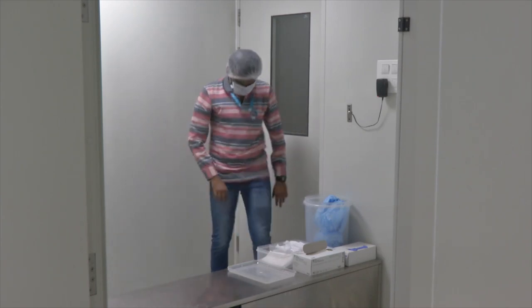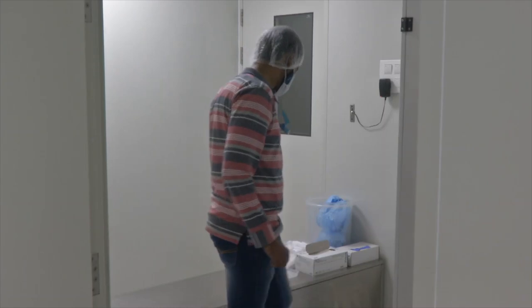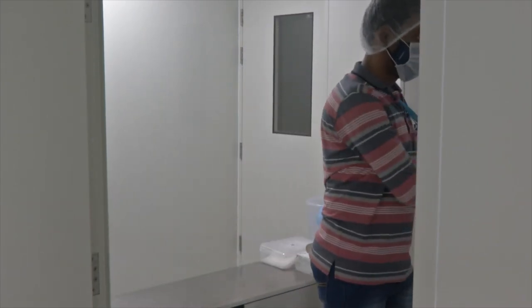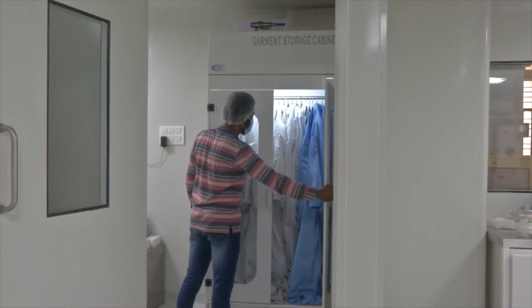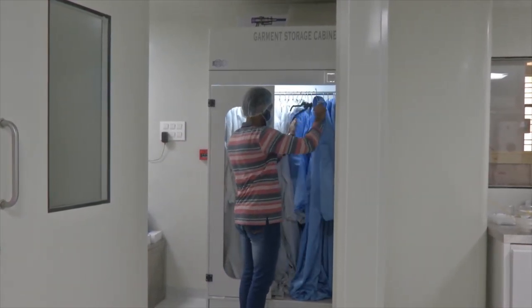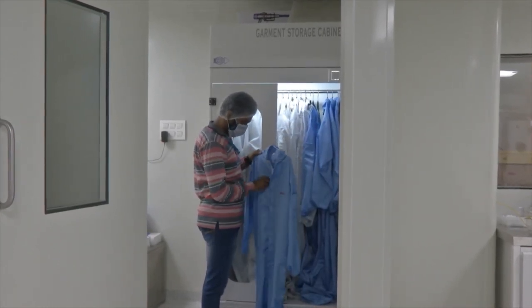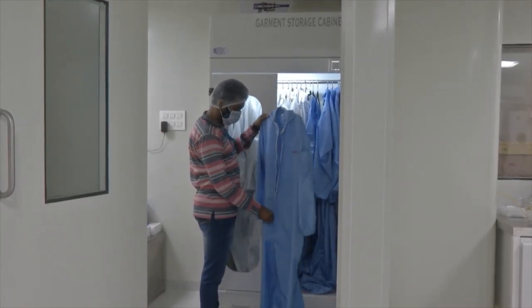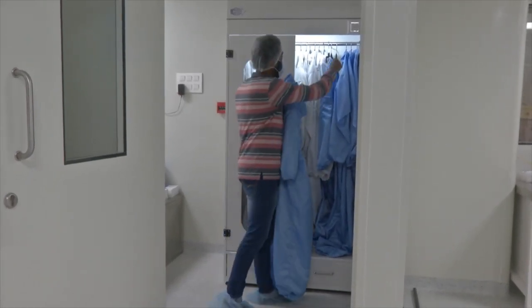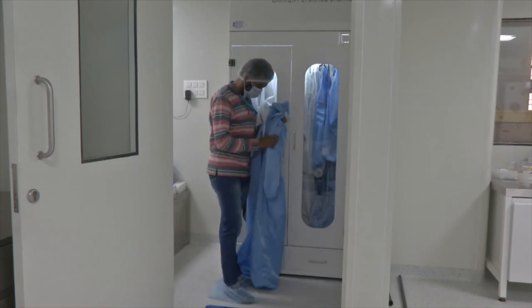After wearing shoe covers, the next step is to don the clean room gown. Clean room gowns are specially dedicated coverall suits designed for working in a clean room environment. They do not generate any kind of dust, cloth-like, or fiber-like particles. They are also static charge protected.